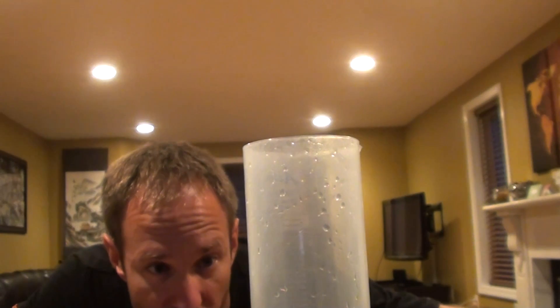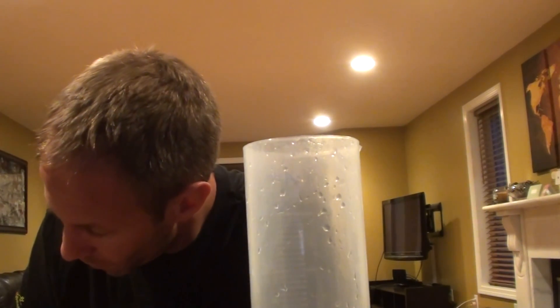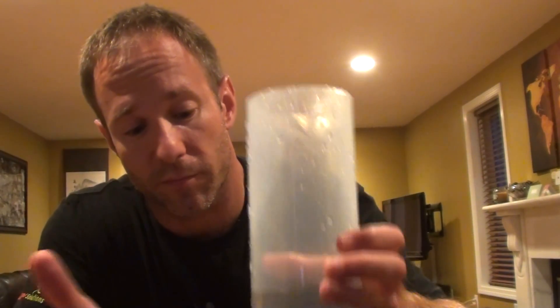Since the rock takes up space, it displaces the water and the water level rises — just like when you go into a bathtub or a swimming pool. Now I'm going to read the volume again, and this time it's right on the line: 540 milliliters. My initial volume was 390 milliliters and my final volume was 540 milliliters. The difference between those two numbers — how much the volume of water increased — equals the volume of the rock: 150 milliliters. It would be even better to call it 150 cubic centimeters, since we typically use cubic centimeters for solid objects and milliliters for liquids and gases. So using this method, the volume of this rock is 150 cubic centimeters.